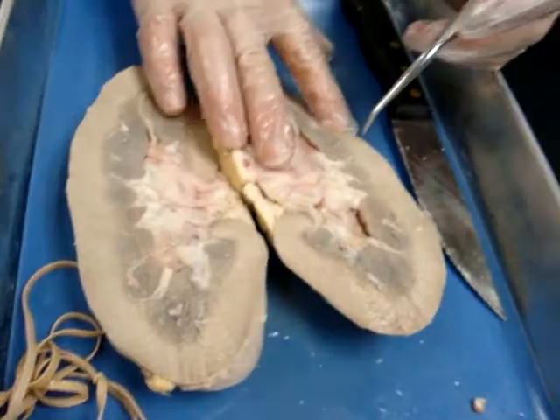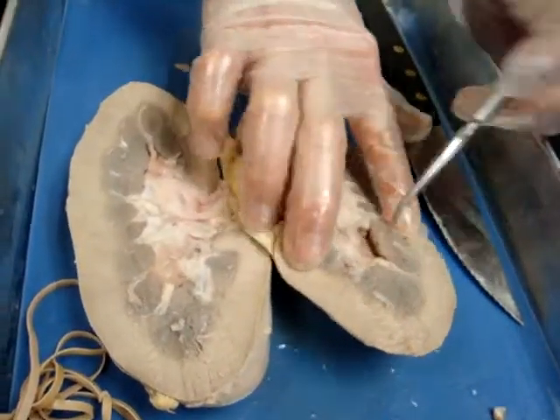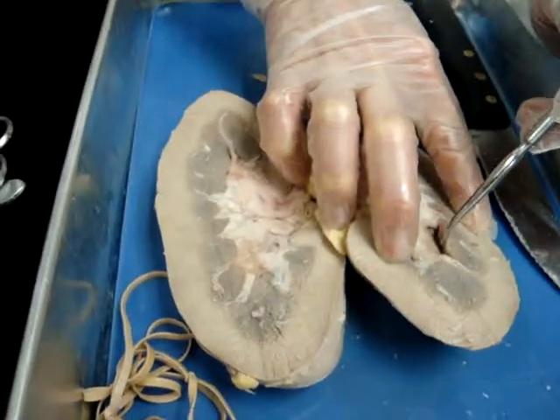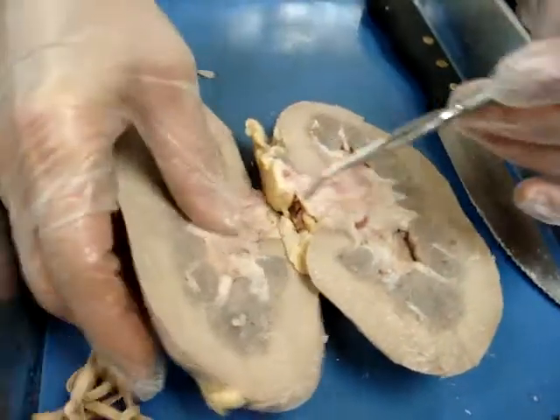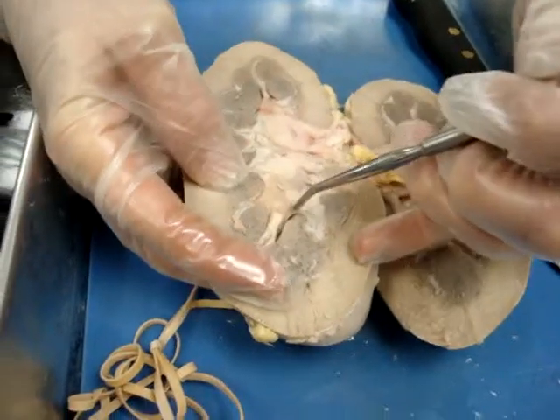On that diagram, there are these little tips of the pyramids — see these bumps? Those are called papillae. Remember, anytime you have a tip, you have a papillae.